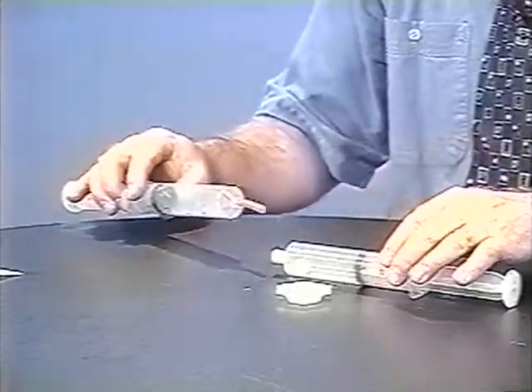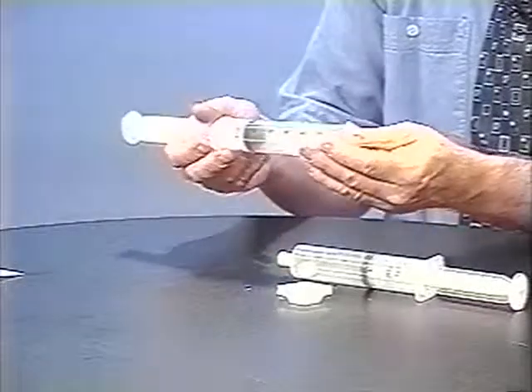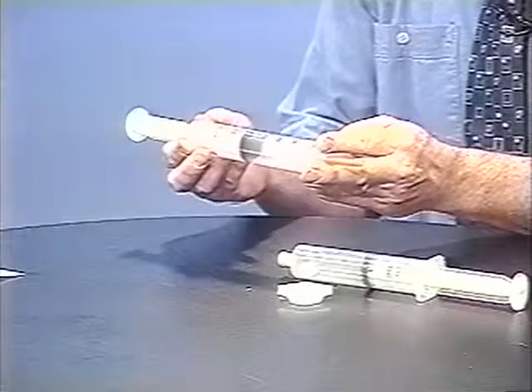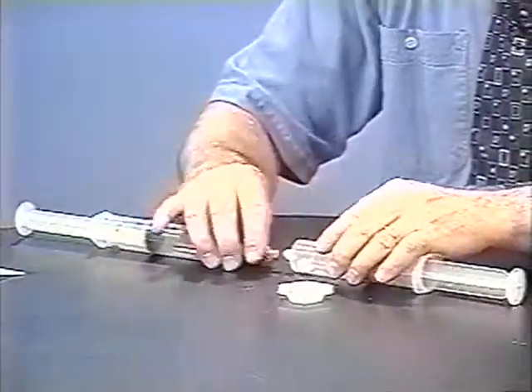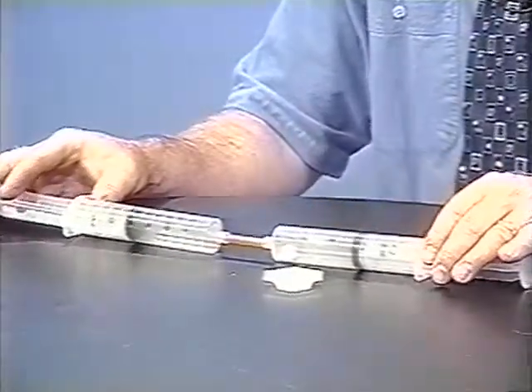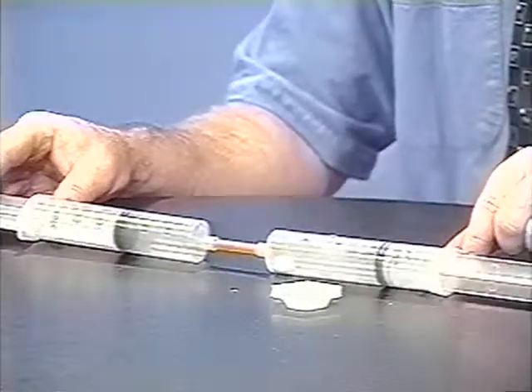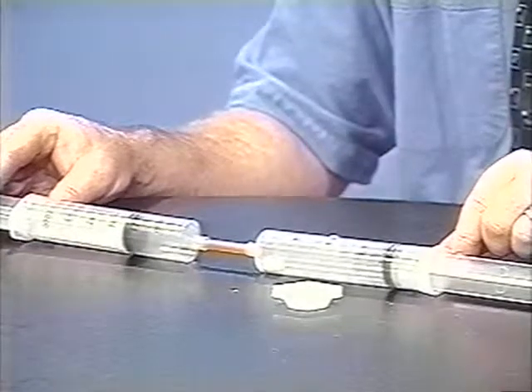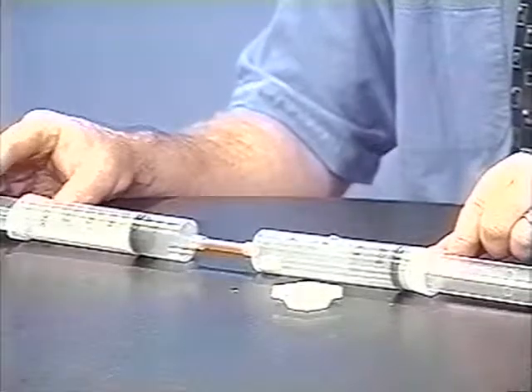To this I'm going to transfer 20 mils of oxygen. I'm going to clean out the little latex tube because it's been sitting around for a bit. Make sure there's mostly oxygen in the tube, connect them up, and transfer 20 mils. When properly lubricated, the plungers move by themselves, though sometimes it's necessary to give them a little wiggle.